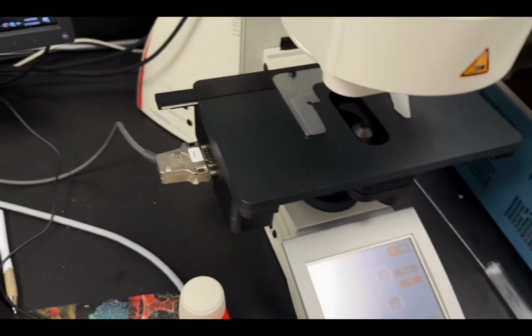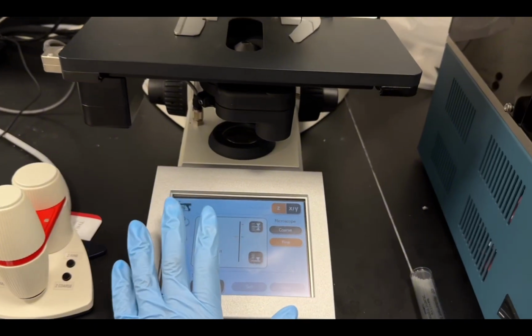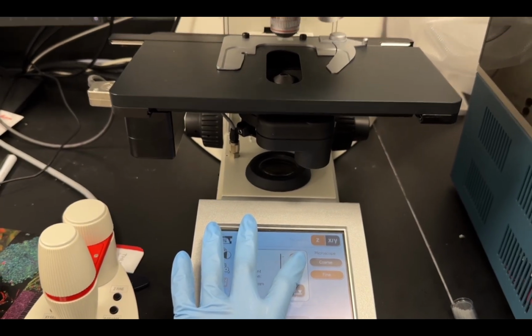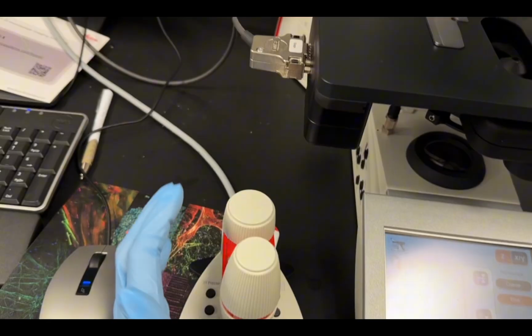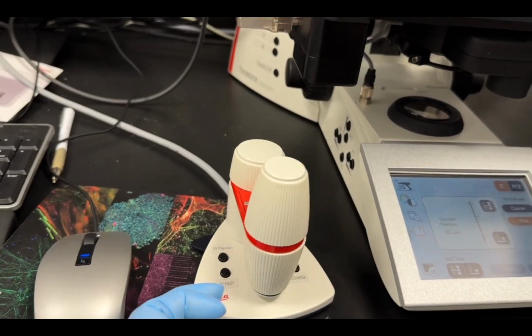So, you know, typically when you're using a microscope, if it's on a higher objective, you're usually going to have this slide be much higher up. So something I like to do when I put my slide in is I'll usually just bring it all the way up to be safe anyway. Then we have these nice guys here. We have a top knob and we have a bottom knob. And you're mostly only really going to have to navigate the top ones. You're not really going to have to worry about this one down here.